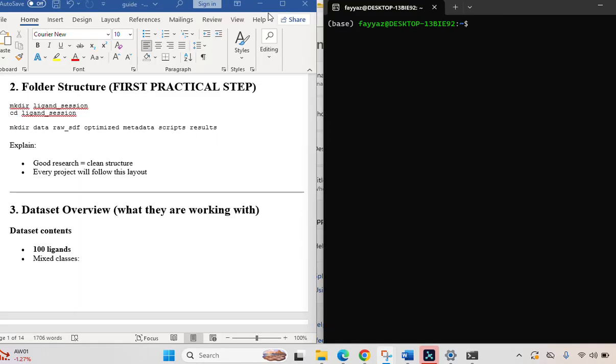Okay, today's session is how to use the commands for copying the files of the ligand structures, and how to polish and optimize them by using OpenBabel. So let's start our session like this. I have provided you a guidebook, and here you can see that we have to make some folders. So why not use the mkdir command? Let's start making a folder, ligand_session, enter.